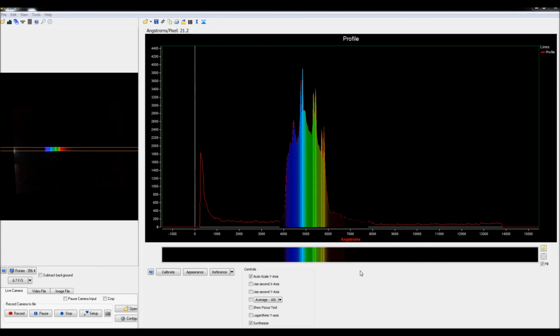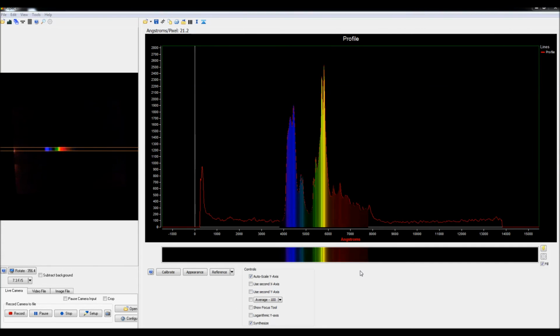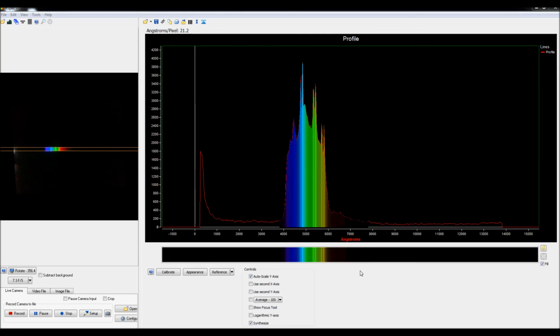And now I'm going to go ahead and drop in the cobalt chloride. And you'll see that it does boost the red spectrum a bit, even further into the infrared. But as you can see, the mercury lines there are way too overpowering. So I'm going to have to find a replacement bulb, hopefully for cheaper than $800. And then I'll upload another video and just show you guys front to back how to build one of these yourself.